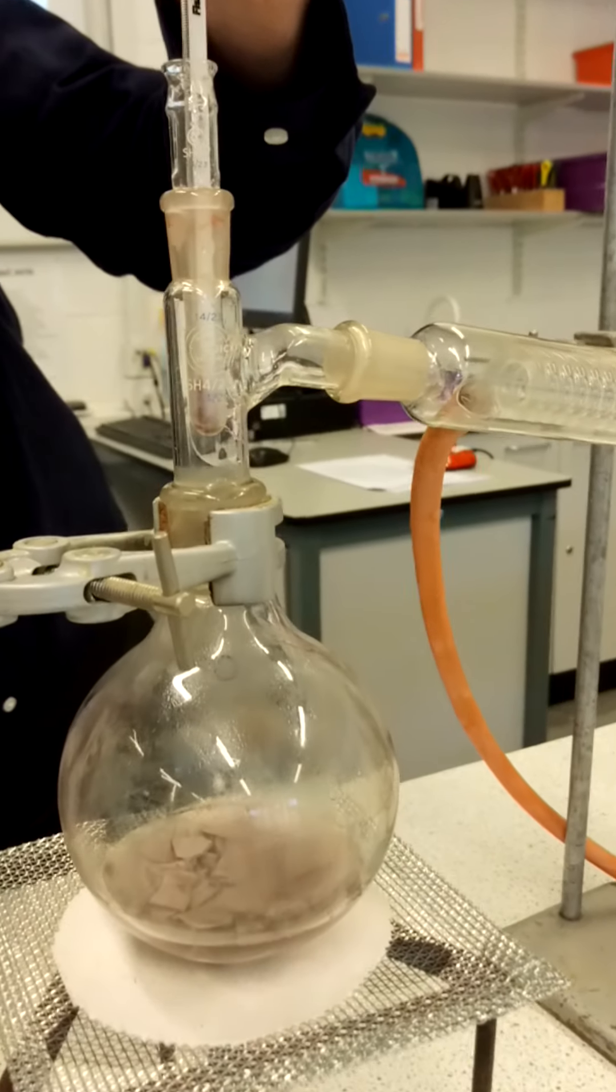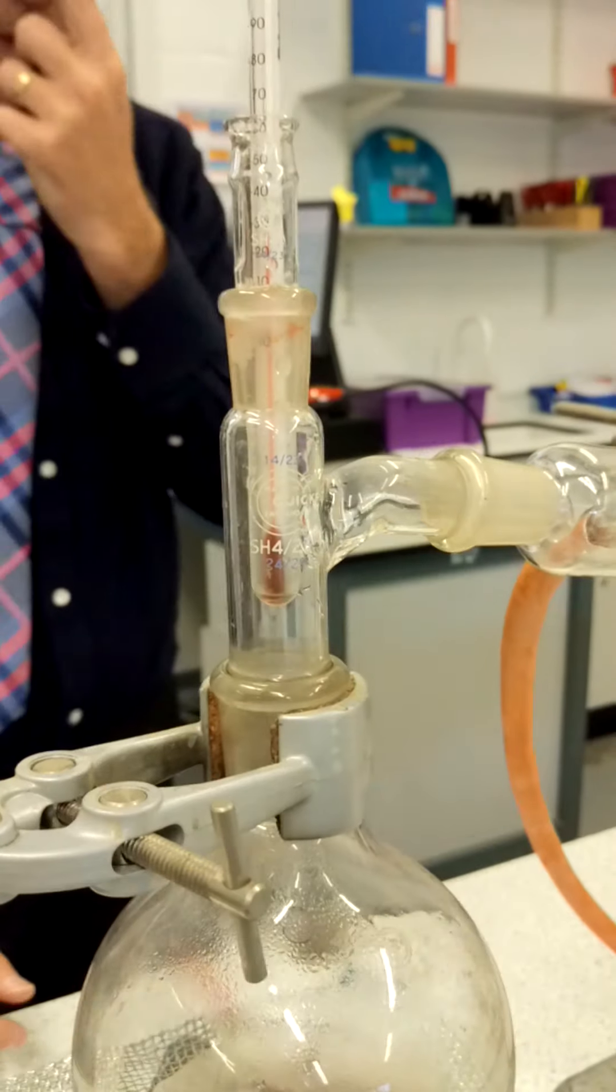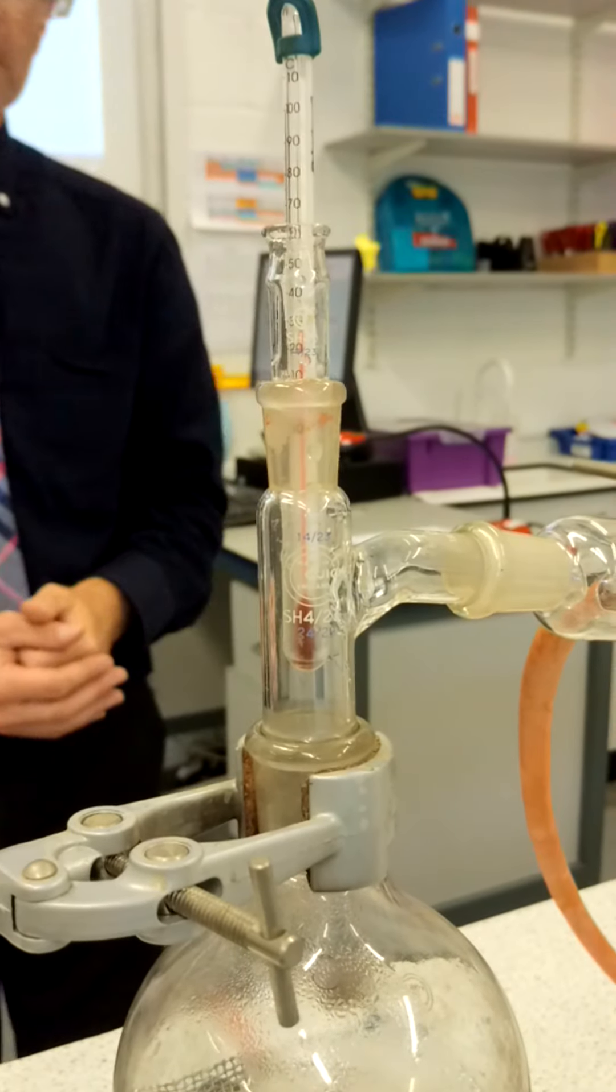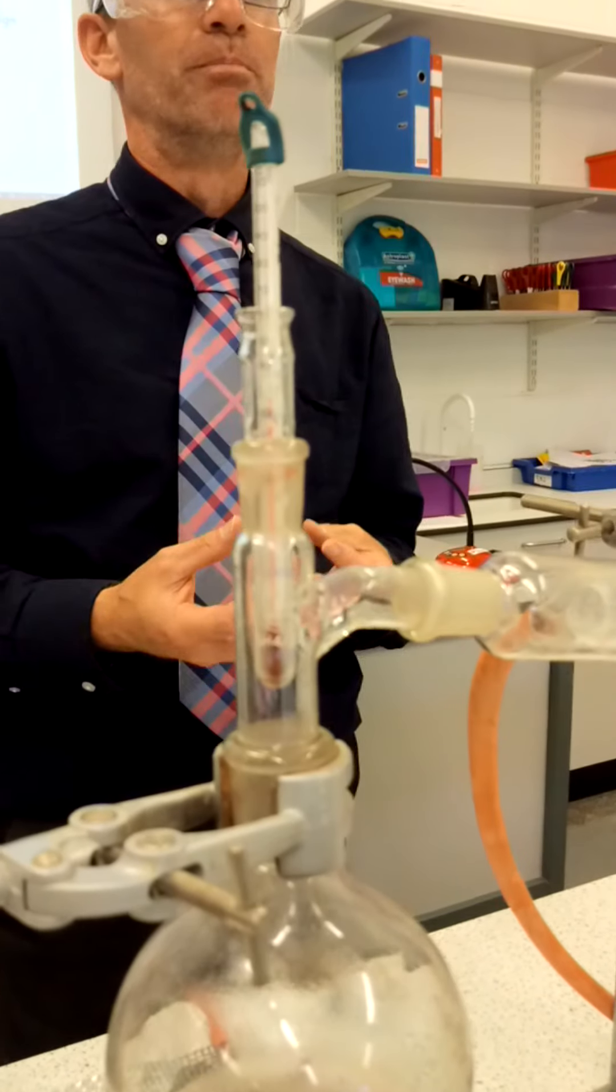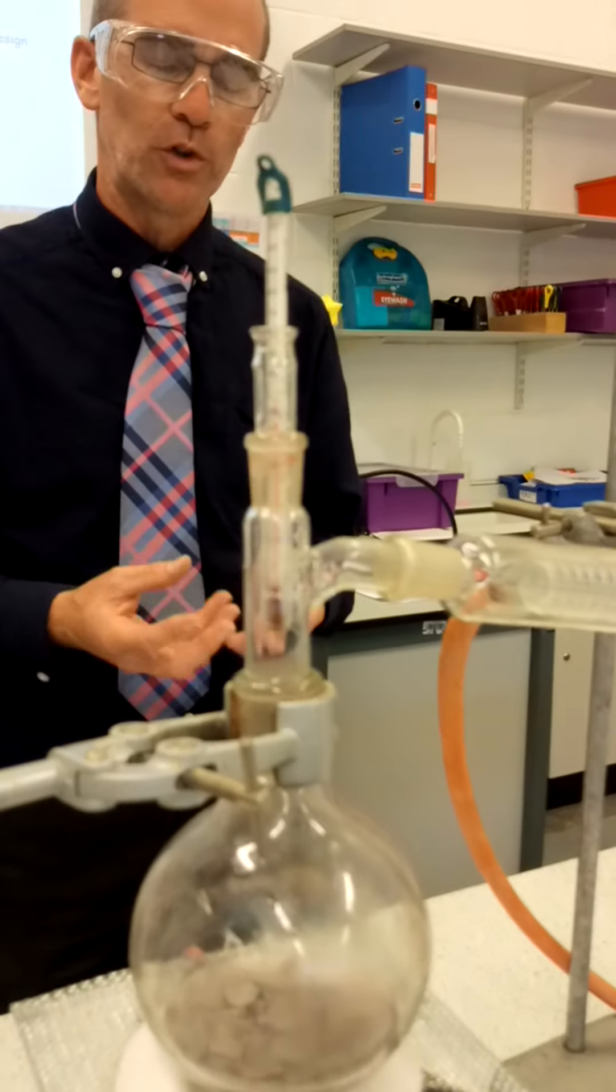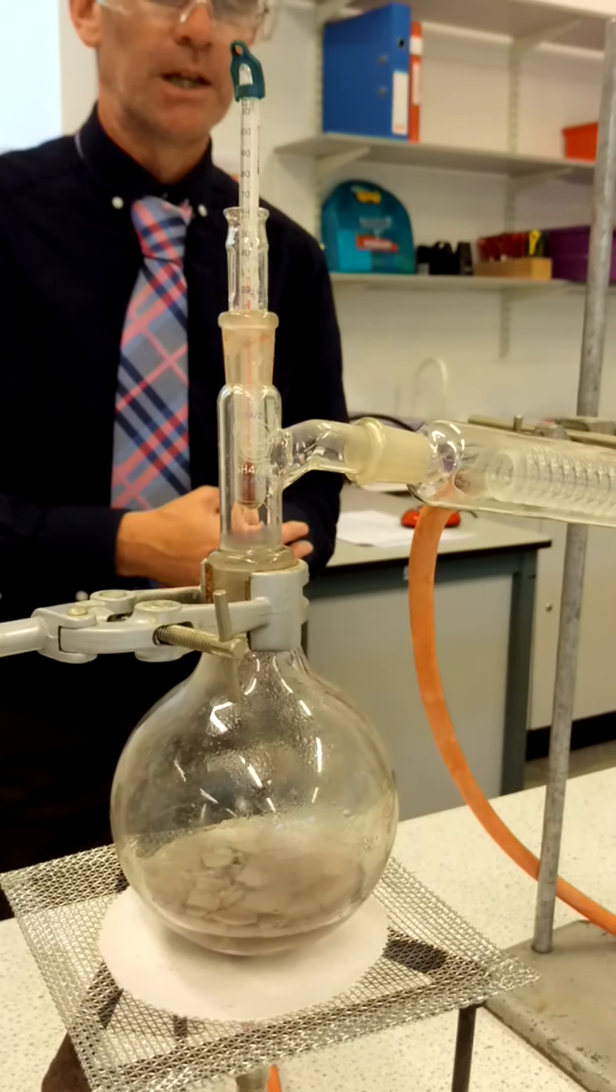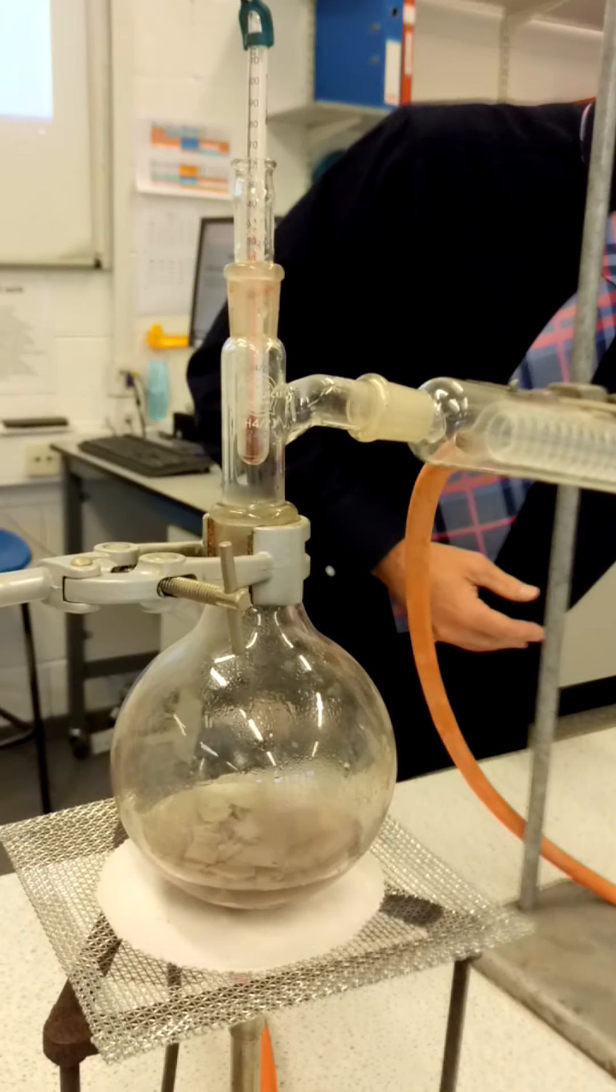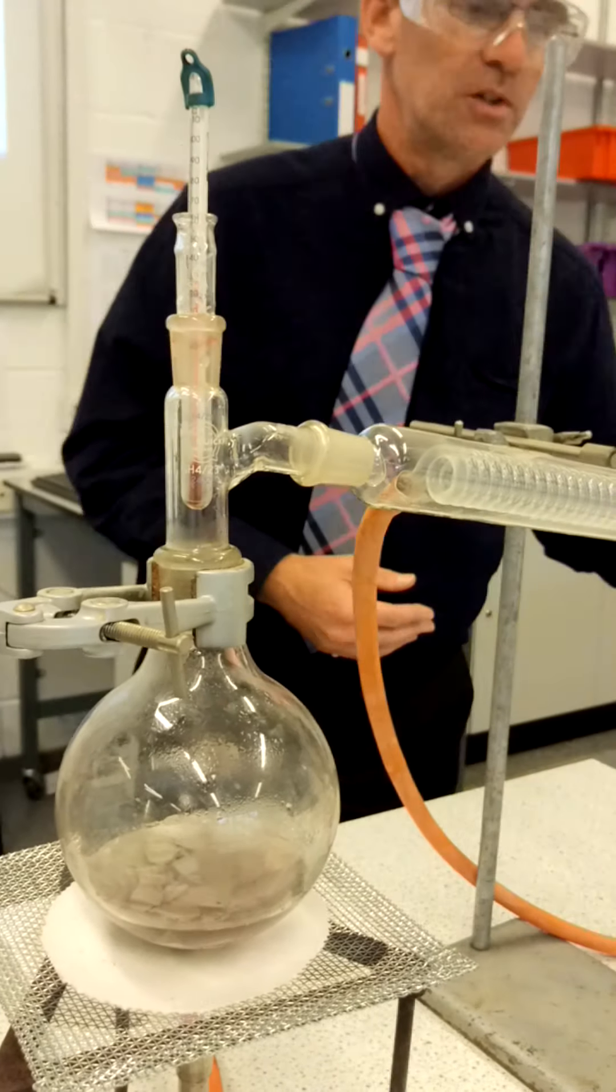So let's have a quick look at the temperature. Right, the temperature at the moment is only around about 30 degrees Celsius. It will warm up fairly quickly. You might be thinking to yourself that you know what the temperature of boiling water is going to be. So you might be thinking already about what you might see happening here in a minute. But then again, you might be in for a surprise. I'm just going to check that it's still running. Yep, the condenser is still working.